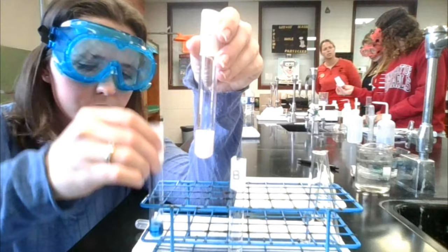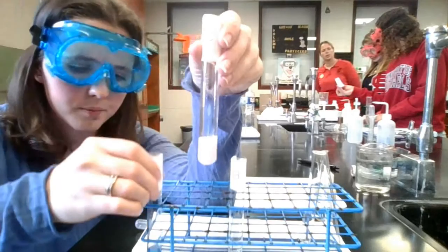So taking away that reactant, it will shift it to the left, to the side of the cobalt hydrate. So you'll see no blue color, and you'll see that red color, and you'll see that white precipitate all throughout. So much so that you can barely even see the reddish pinkish color in the video, but it was there.